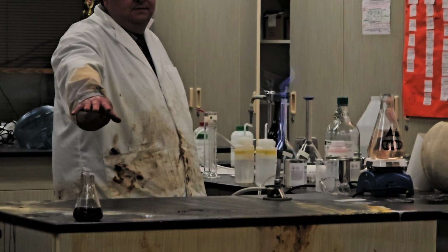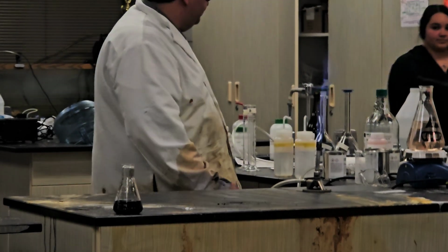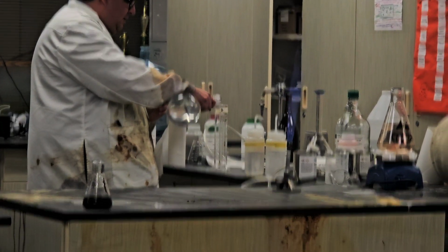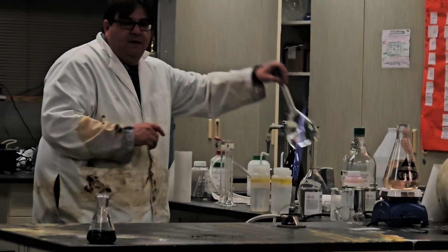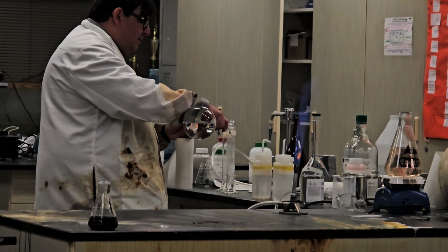Oh, what the fuck? It turned black. His clothes? No, the liquid, yeah. So, I'll do it one more time, but again, you guys got to think about it.